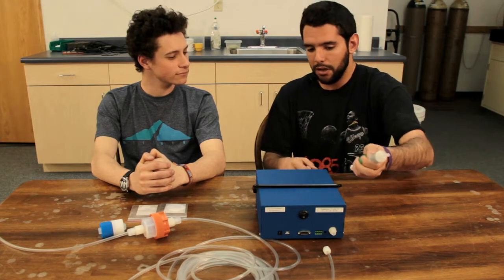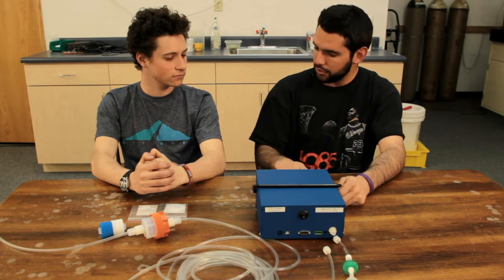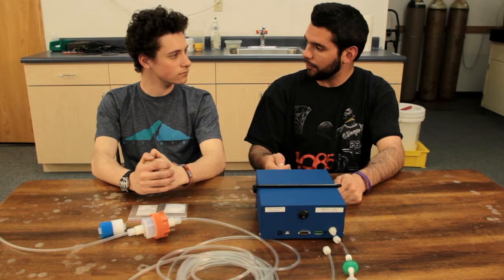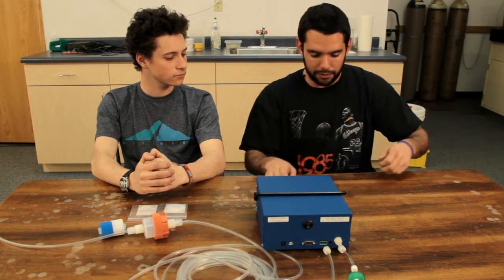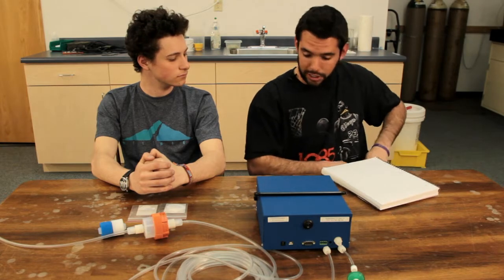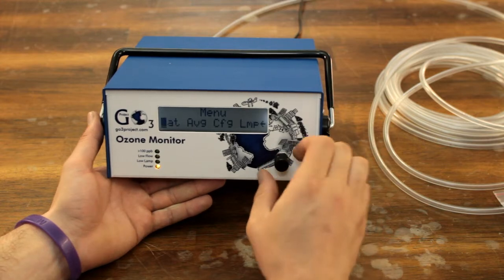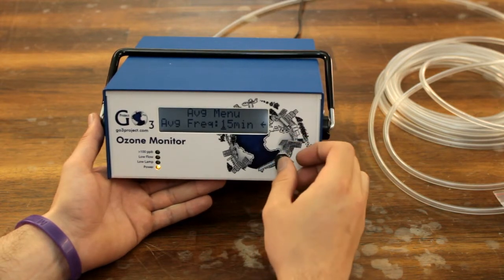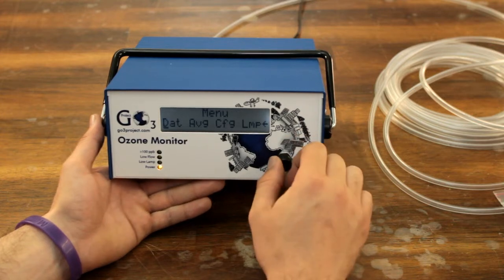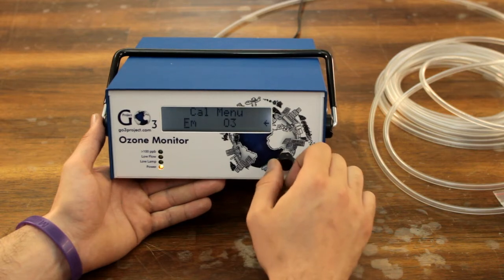Once we've attached that, we'll go ahead and just sit here and see if our Z is reading 0. If it's not reading 0, we're going to go ahead and account for doing some measurements. The way that we're going to do the measurements, we're going to change our measurement time to 10-second measurements. So we'll go into Menu, Average, change it to 10 seconds instead of 15 minutes. We'll also go in and change our Z. So we'll go to Menu, CFG, Cal, and we'll change that Z to 0.